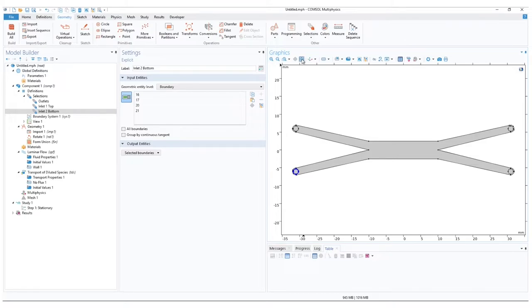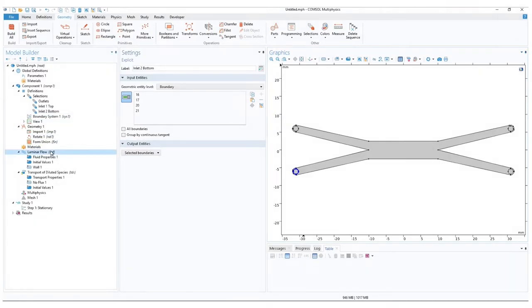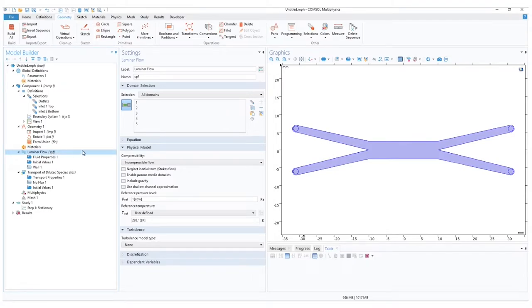Next, let us move to physics of laminar flow. Click on the physics to open its general settings. In the domain selection, we need to make sure that only domains are selected where flow is expected. Firstly, clear selection and select the main channel.